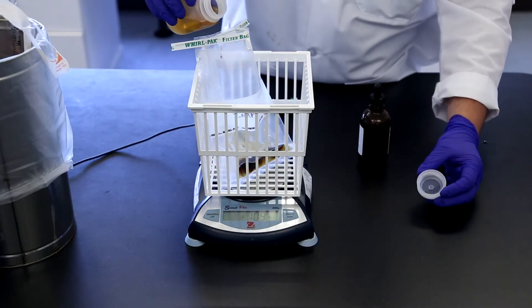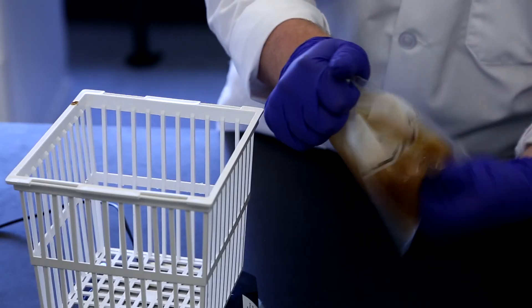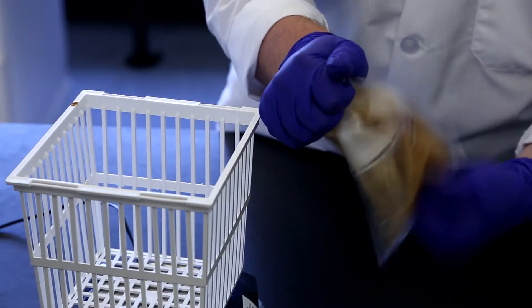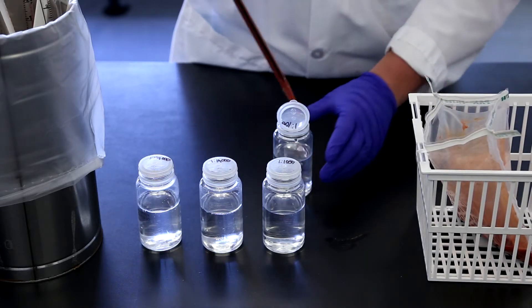Testing specification monitoring may require making dilutions of your prepared sample. In part 1, we created a 1 to 10 dilution. Now let's make serial dilutions from 1 to 100 to 1 to 100,000.